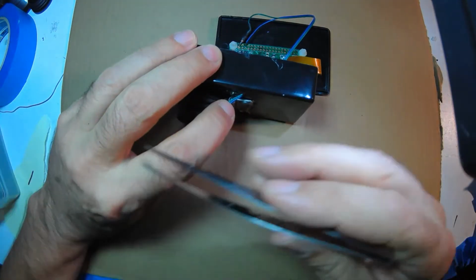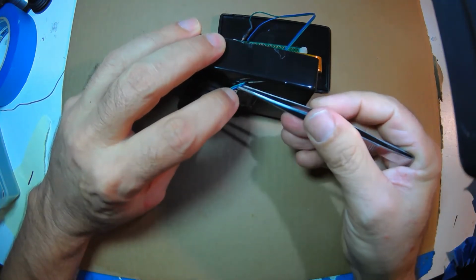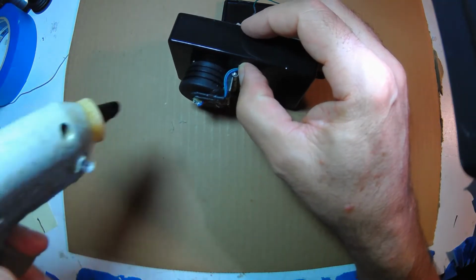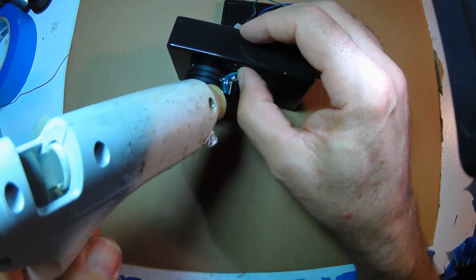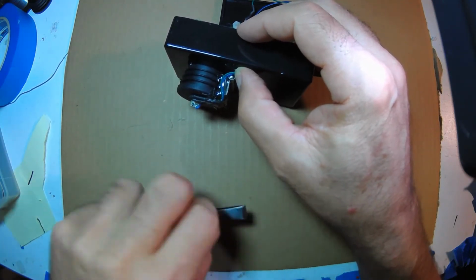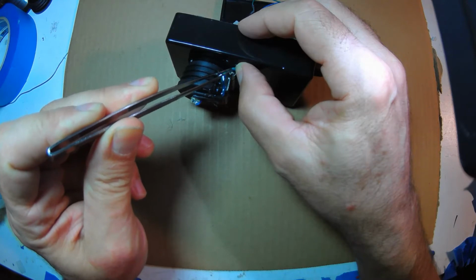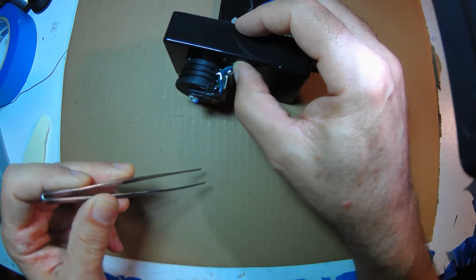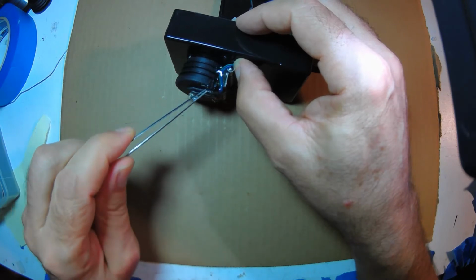Okay, yeah, that's what I want, just like that. Okay, more glue. That's good. So you see how the pivot point of the hinge is here, so that this wire will just flex right there, and all this stuff is staying still. So that should last a long time. Once that hardens, I'm going to glue the rest and seal up that hole so no water gets through.